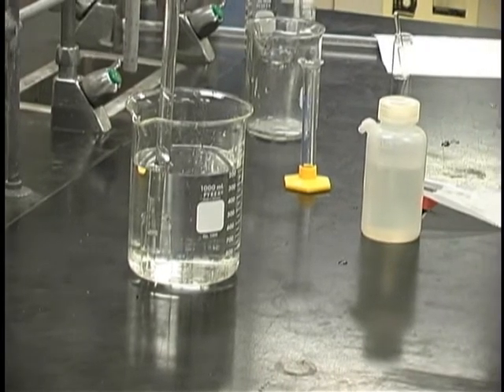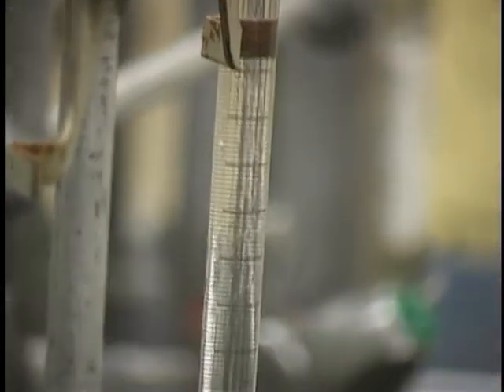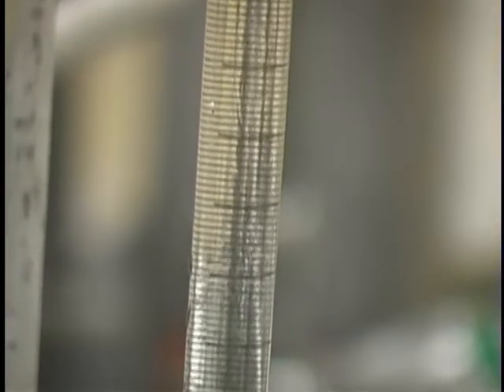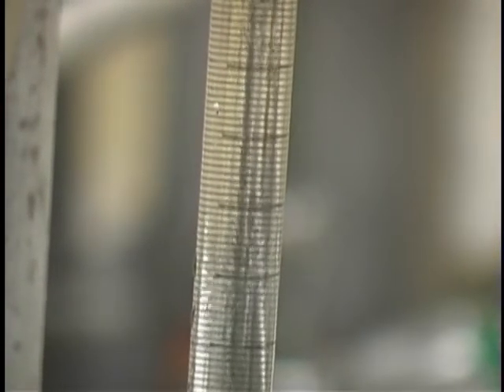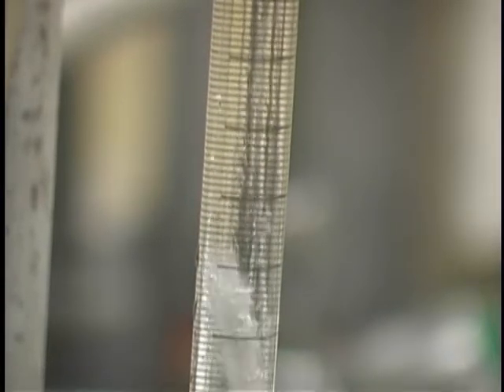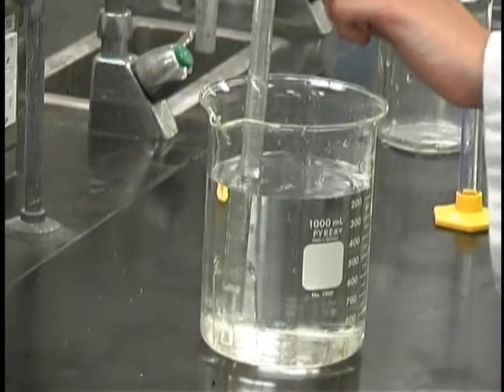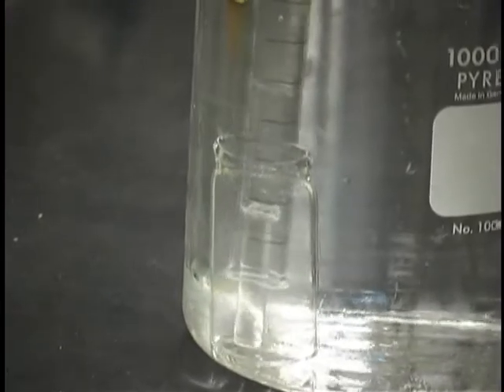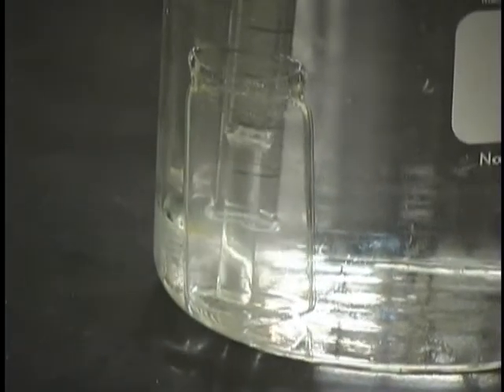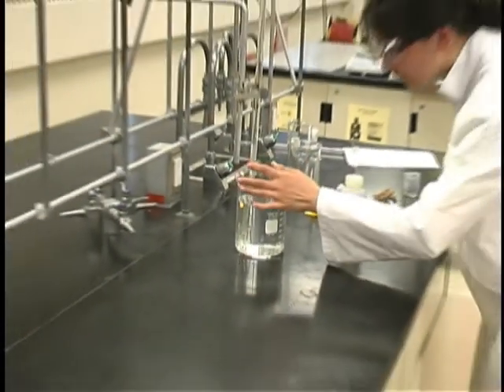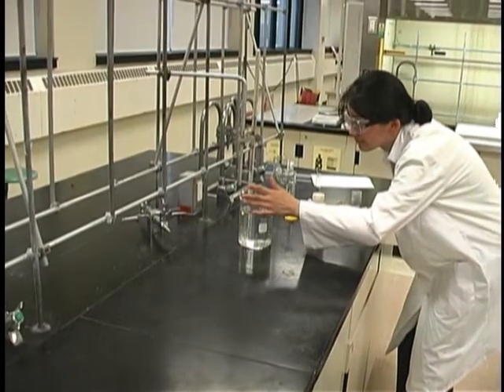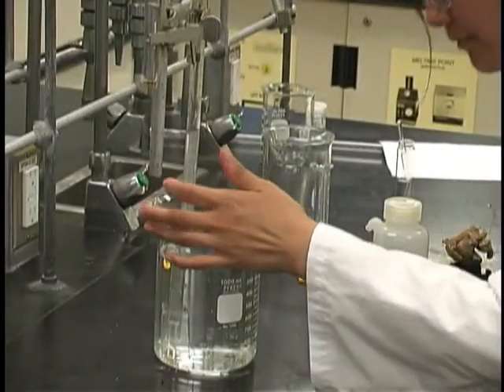If you watch carefully, you can see the acid swirling down the tube. You must be continually watching because when the acid comes into contact with the metal, you'll see hydrogen begin to be produced and the metal will rise. Gently tap the tube to ensure that the metal stays in contact with the acid water. If the metal sticks to the glass, you will have to repeat the experiment. Continue tapping until all the metal has reacted.